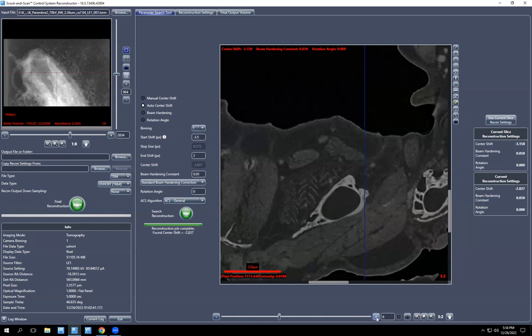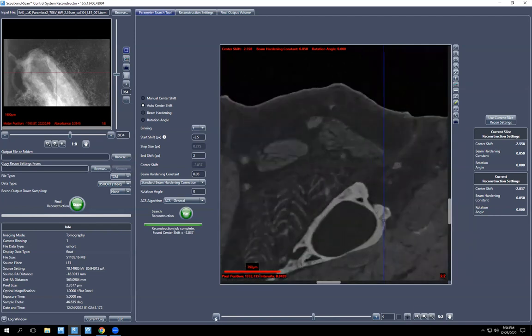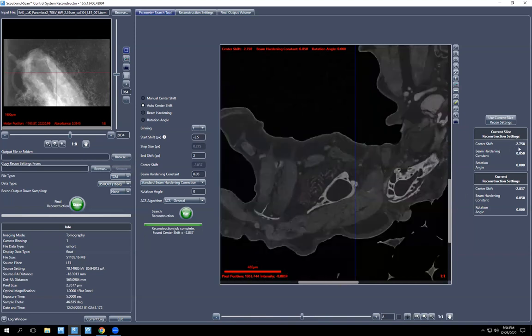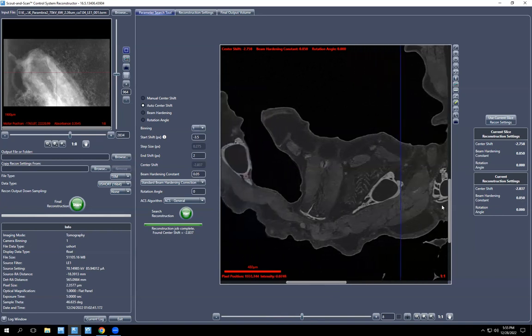Let's see. Maybe, maybe not. Maybe the best one is actually somewhere. No, I'll go back. It's hard to say. I'm gonna take that. But I'm actually going to not take it. So if you want to take your manual one, you have to click use current slice recon settings and it will replace this one. But I'm actually going to keep this one because I think it might be better. So that's how you find your center shift.